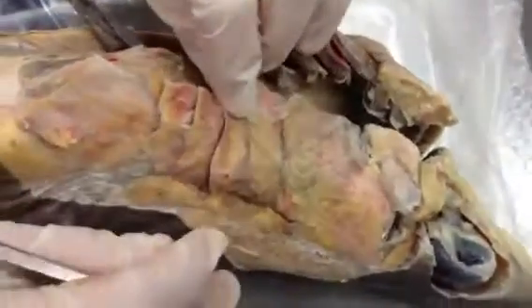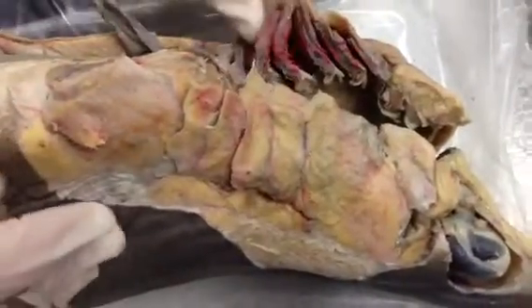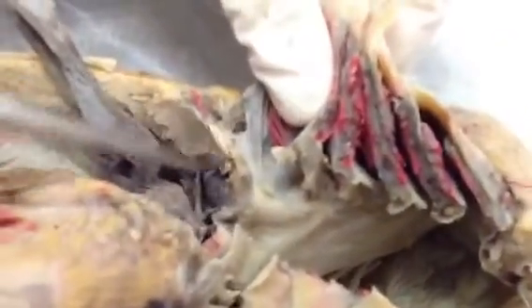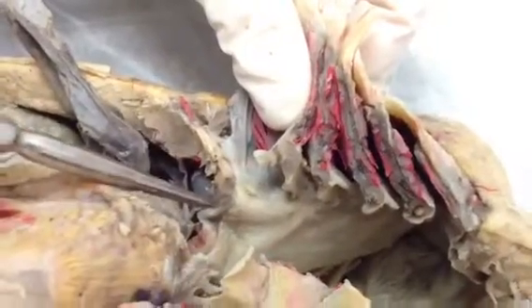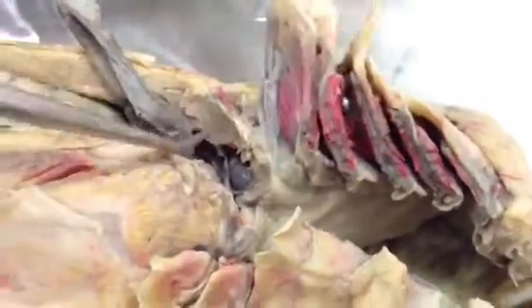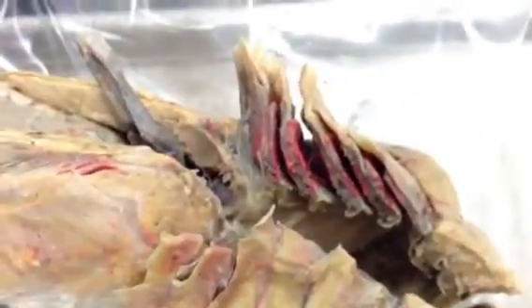It's also important to know that the fifth arch, which you saw here, does not have any lamellae and doesn't have any gill rays. Therefore, it's not actually considered a gill itself — it's just the arch itself.